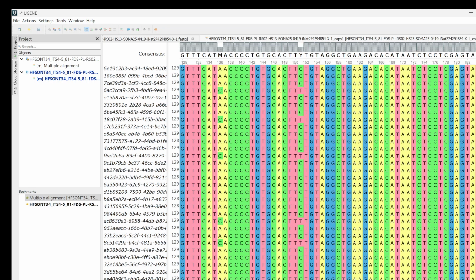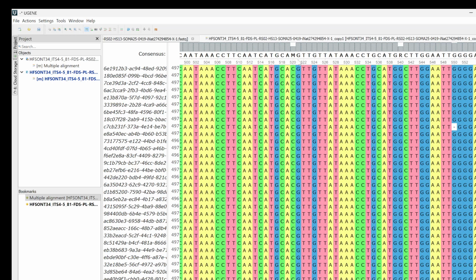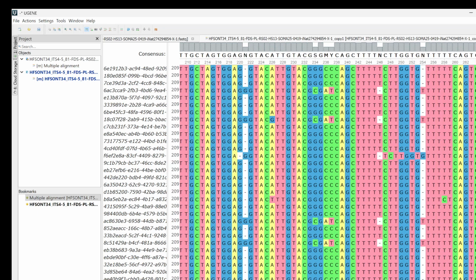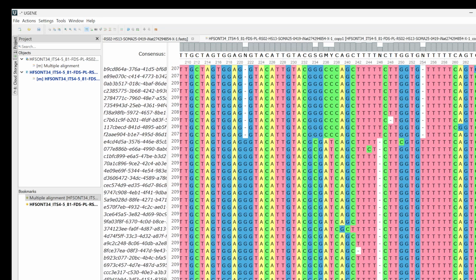As you can see down here, there is a whole lot of stuff going on. And sure enough, as we slide through these different little blips in the alignment, we see polymorphisms galore. So this is indicating to me that there's probably some haplotype variation. And indeed, if we go to one of these spots, we can scroll down and we can see there's a breakpoint there where there's a significant difference.